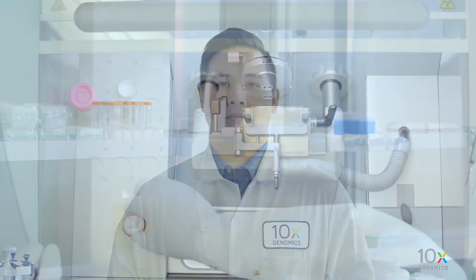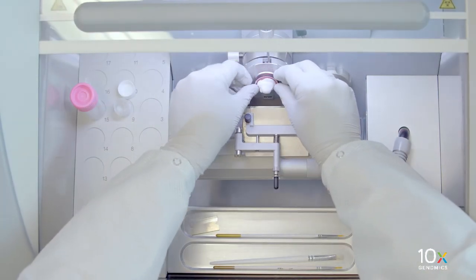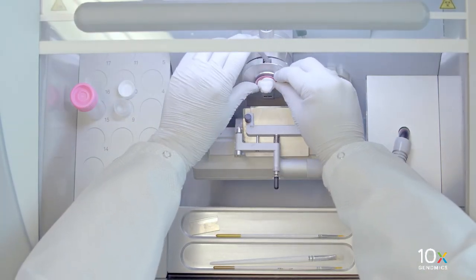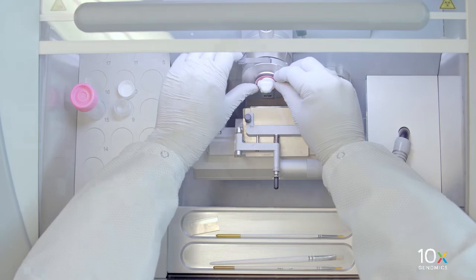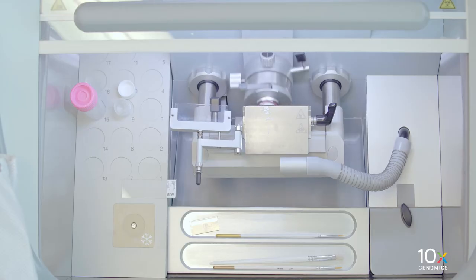We are ready to cryo-section our OCT embedded tissue block. Install the stage with the tissue block onto the specimen head of the cryostat. First, we will remove the excess OCT and expose the tissue. Continue sectioning until the tissue is visible.